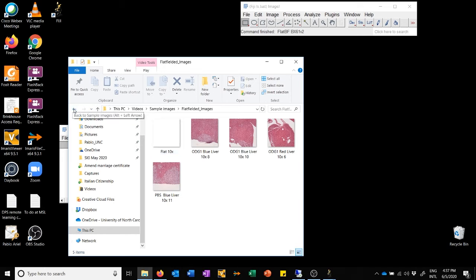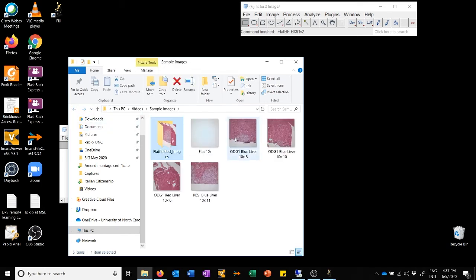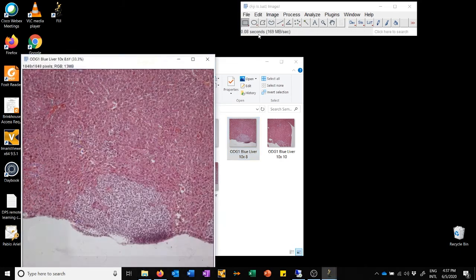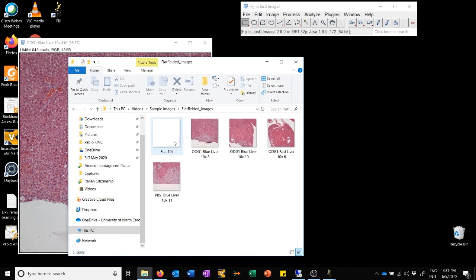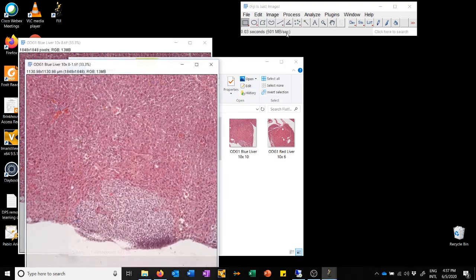So now let's just compare them. If I grab this file and I drag it here, and then I drag the flat fielded version of it up here. So it's ODG1 Blue Liver 10x8. Okay, so I'm going to drag that here.